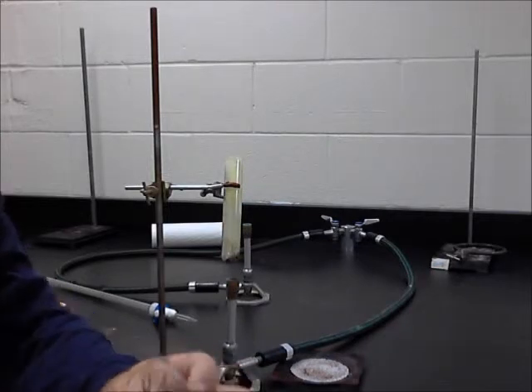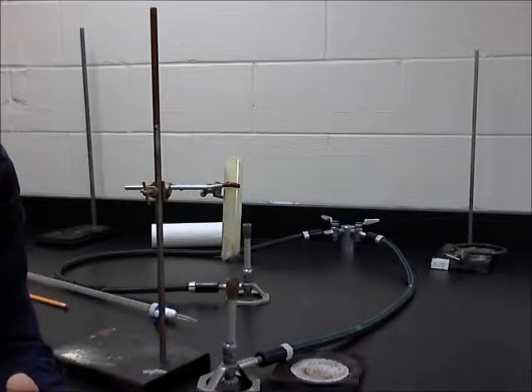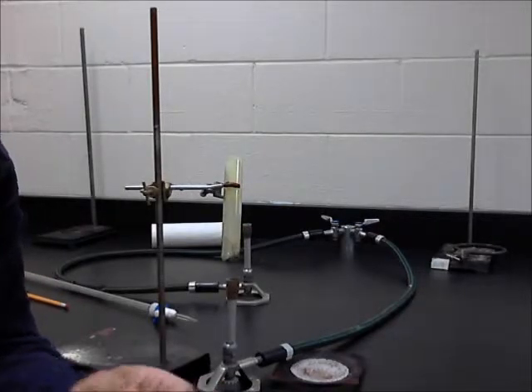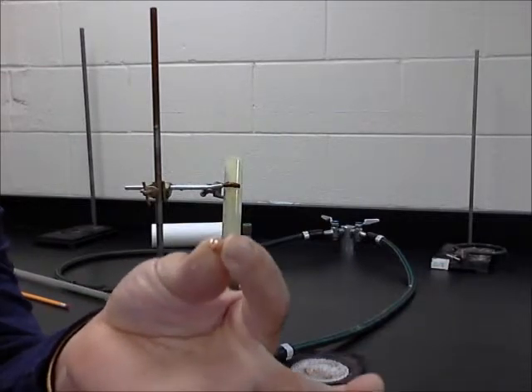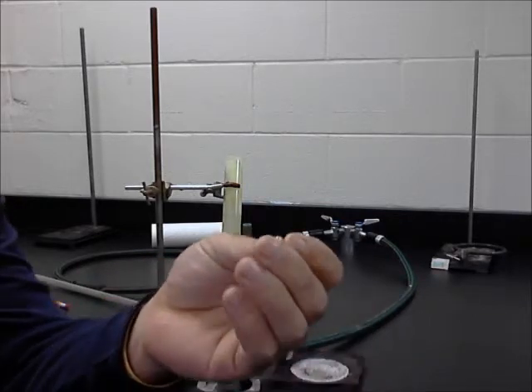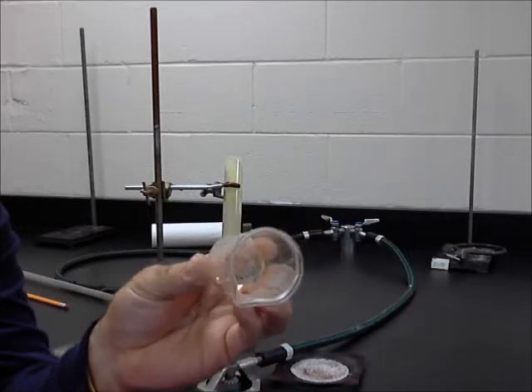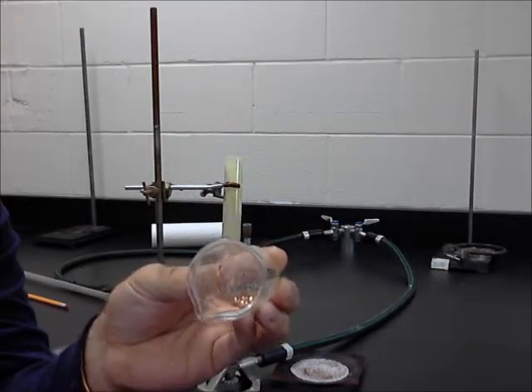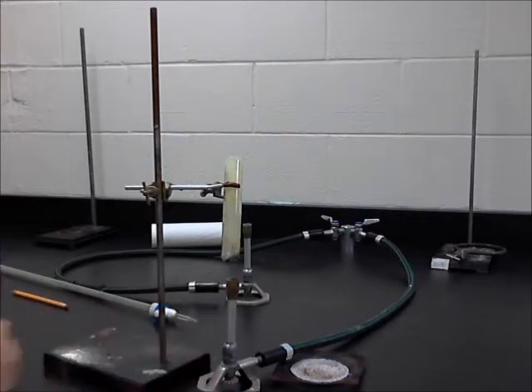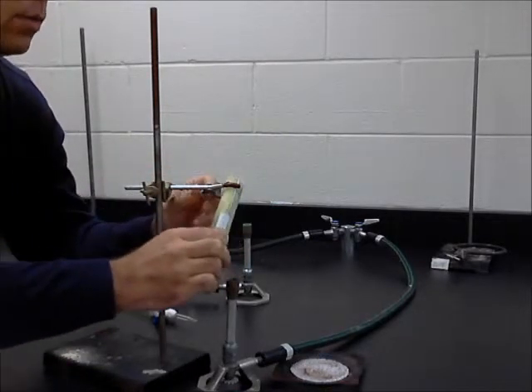And then here we have copper. It's copper, so it's got copper color. Somewhat malleable. I'm using chunks at this point, but you could easily use dust of some sort. So those are the physical properties of the stuff that we are using. We're going to take these and mix them together.